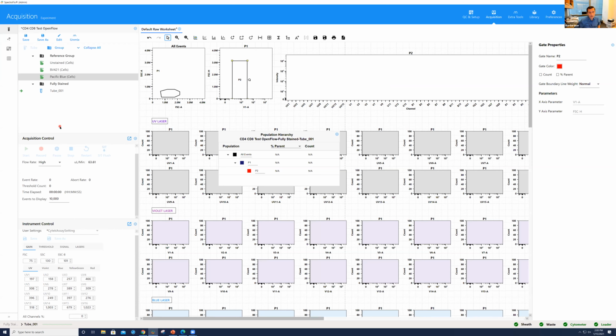So let me just add there. I think Cedric is also mentioning the fact that if each channel is too diffused, so if you're still seeing a lot of the unstained, or the autofluorescence together with the signal, that may be an indication that the staining is not very good.